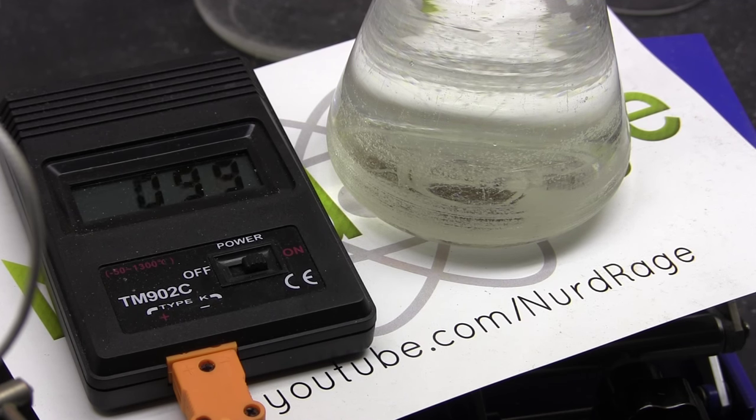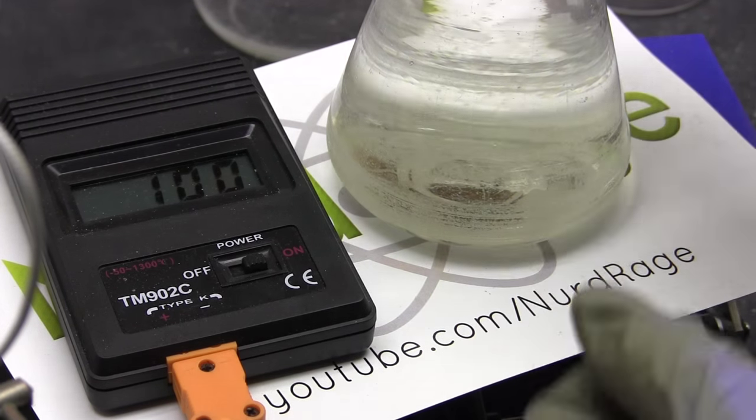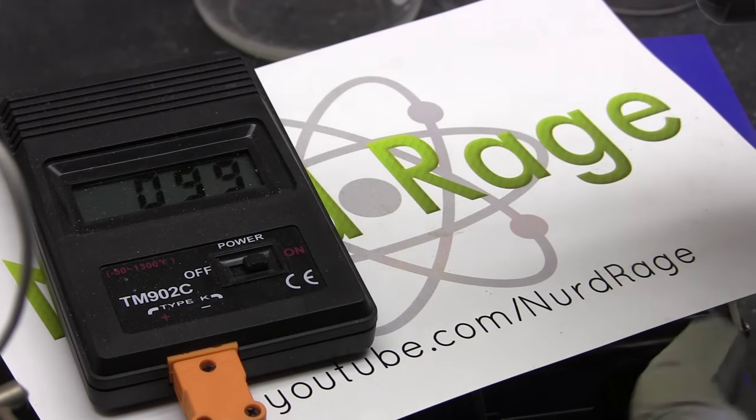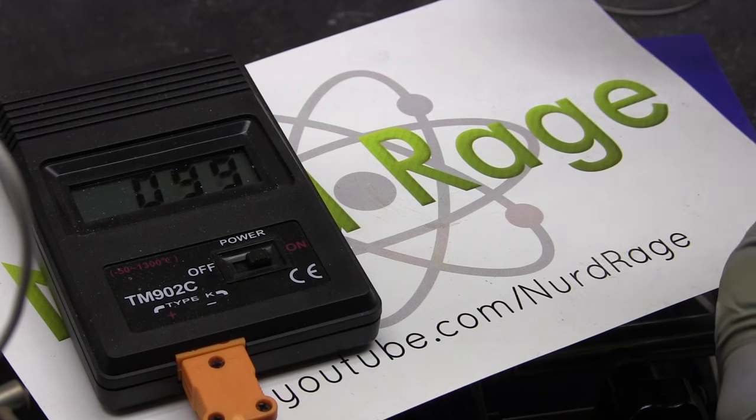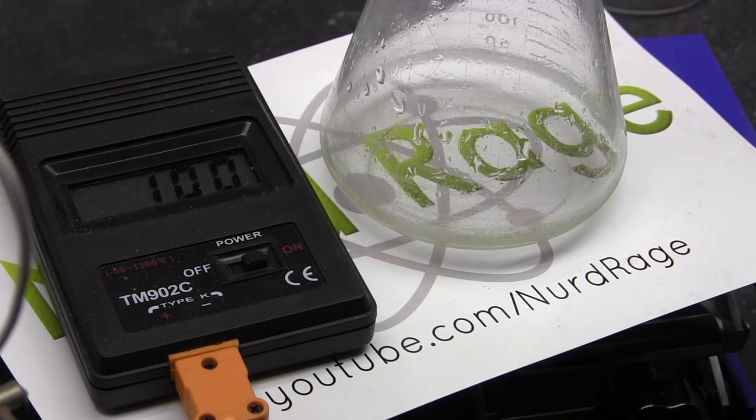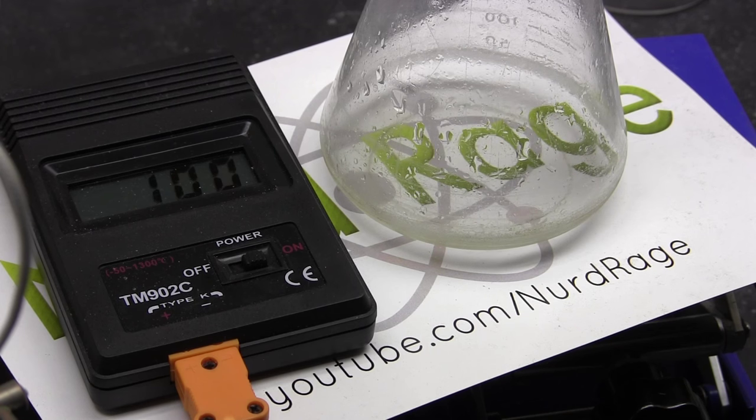Propionic acid can also be recovered by liquid-liquid extraction using a non-aqueous organic solvent like diethyl ether. While it is likely much faster, I didn't do this since I had a gallon of solution to process and I didn't want to deal with the proportionately large amount of organic solvent. Anyway keep distilling everything that boils at around 100 degrees celsius.